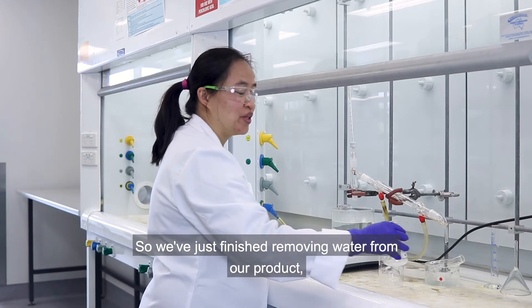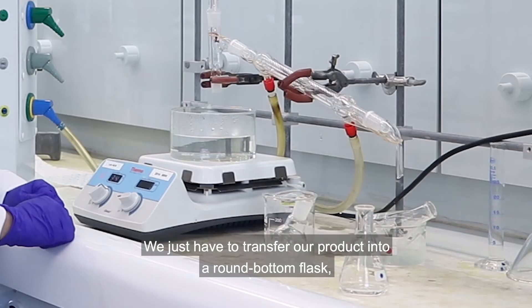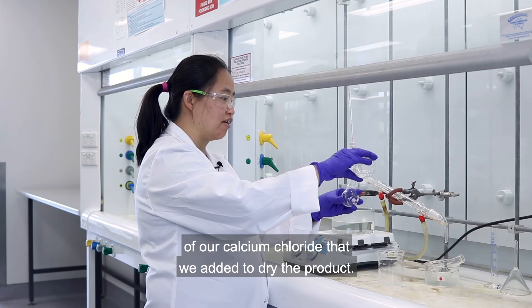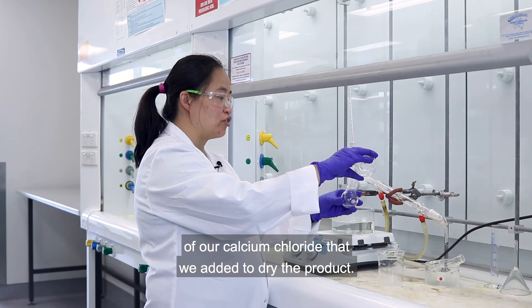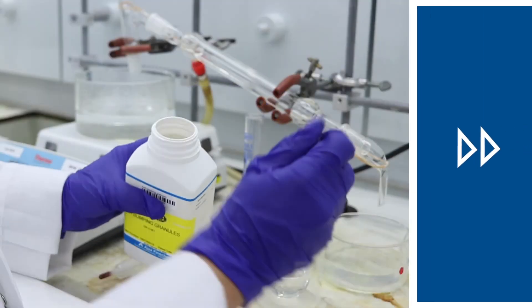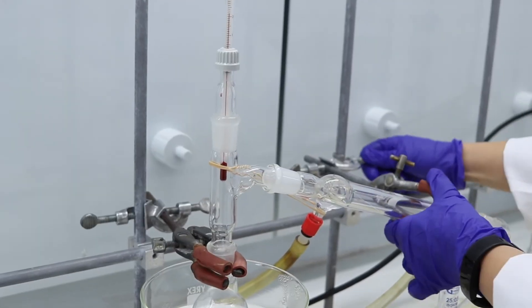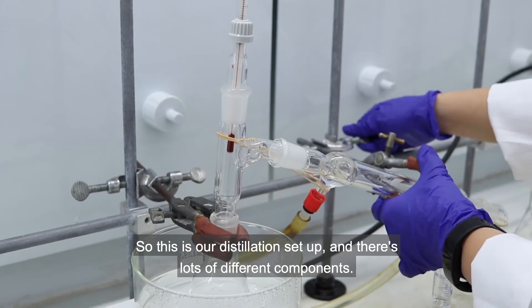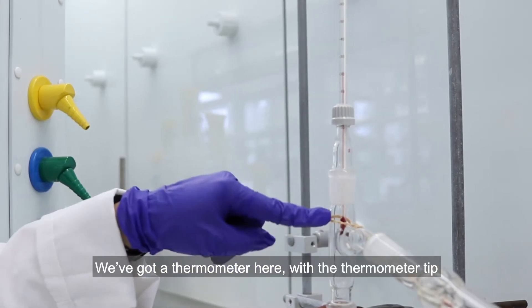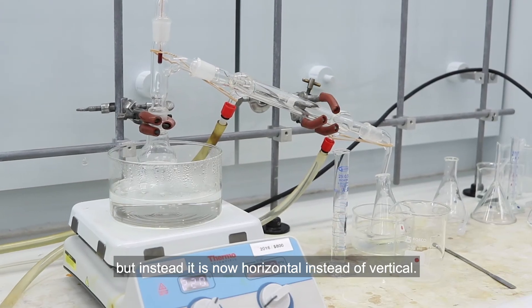We've just finished removing the water from our product and the next step is to purify our product, and we do that using distillation. We just have to transfer our product into a round bottom flask, taking care not to include any of the calcium chloride we added to dry the product. We'll add a couple more boiling chips. This is our distillation setup — our clamp is tightly hooked onto our round bottom flask, we've got a thermometer with the tip just at the junction where it crosses over, our condenser — the same condenser used for reflux but now horizontal instead of vertical — and then a clean conical flask in an ice bath.